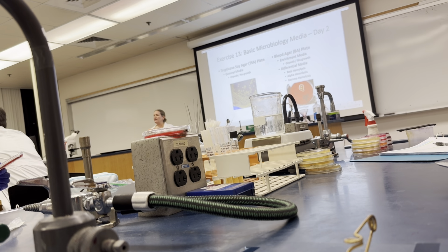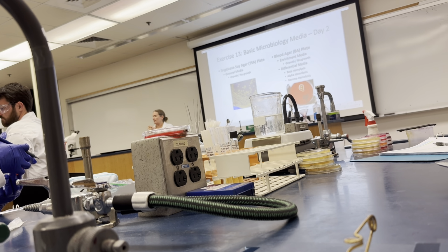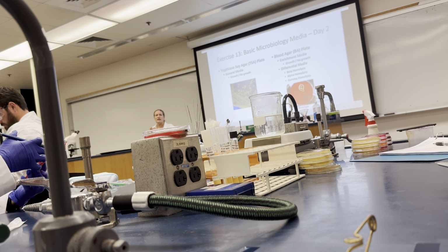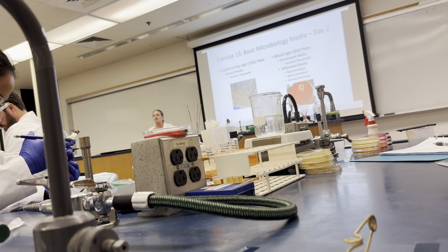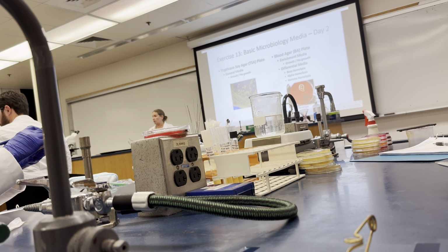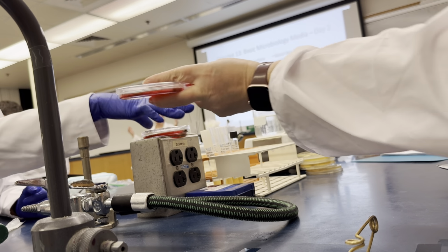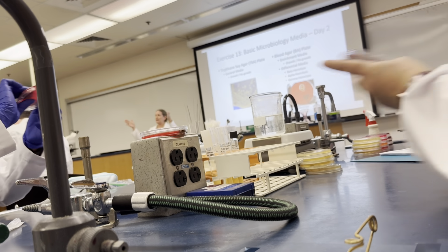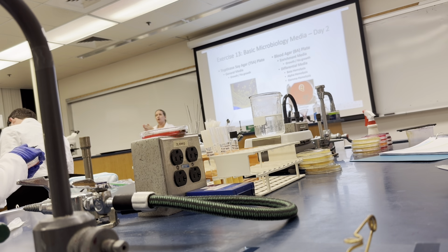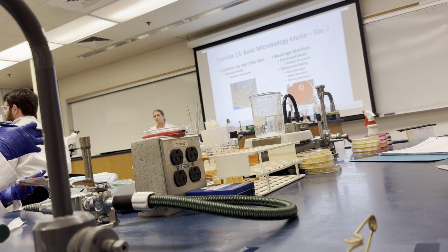If you have to open the plate to actually look, do that. Open up the plate to look at the colonies, the individual cells. Do you see a halo around cells? No. And then gamma hemolysis is no hemolysis at all. In this case, when you look at a colony of growth, as you move from the media towards the colony of growth, there will be no change in the color of that media.